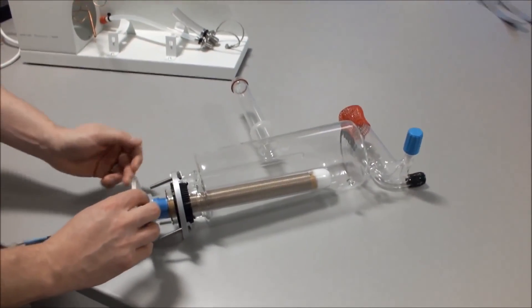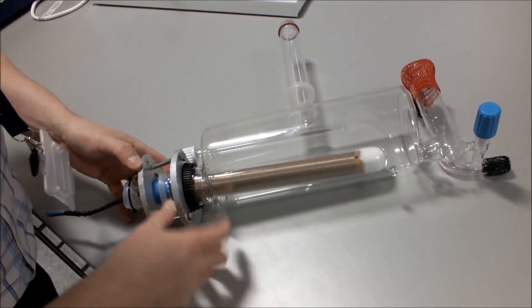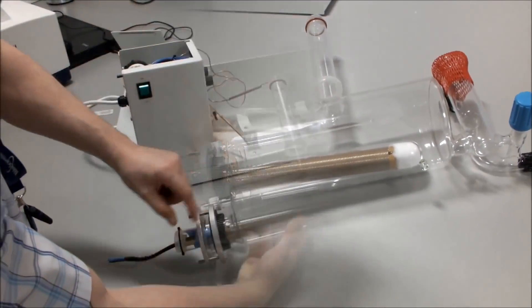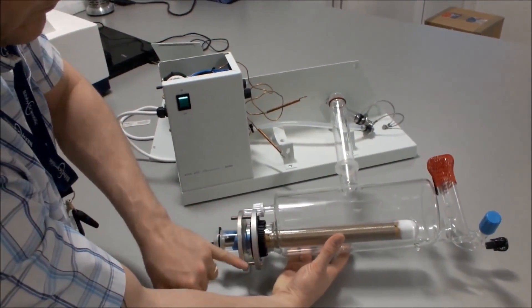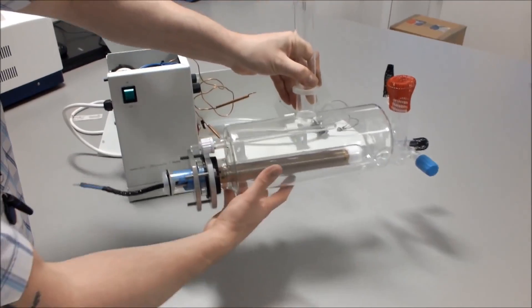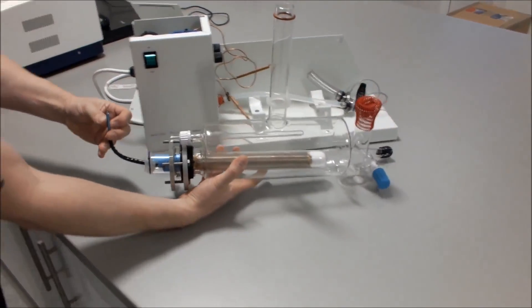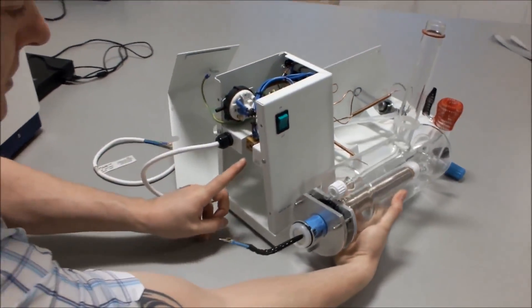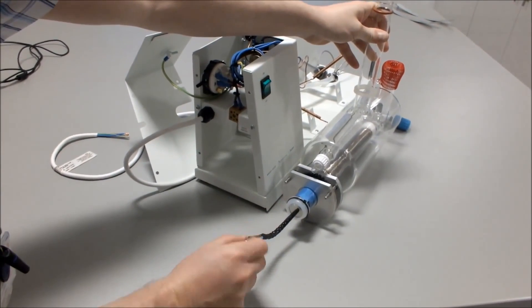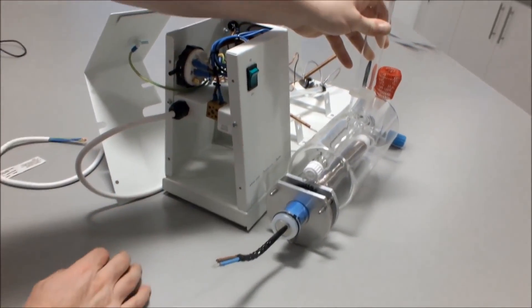As you can see, the two flats are at the top. We then line up the screw holes and start to tighten the screws. Now we need to place our boiler onto the stand, ensuring that the heater leads come up and fit exactly into the heater terminal block. If the cables are twisted the wrong way it will be extremely difficult to attach them.